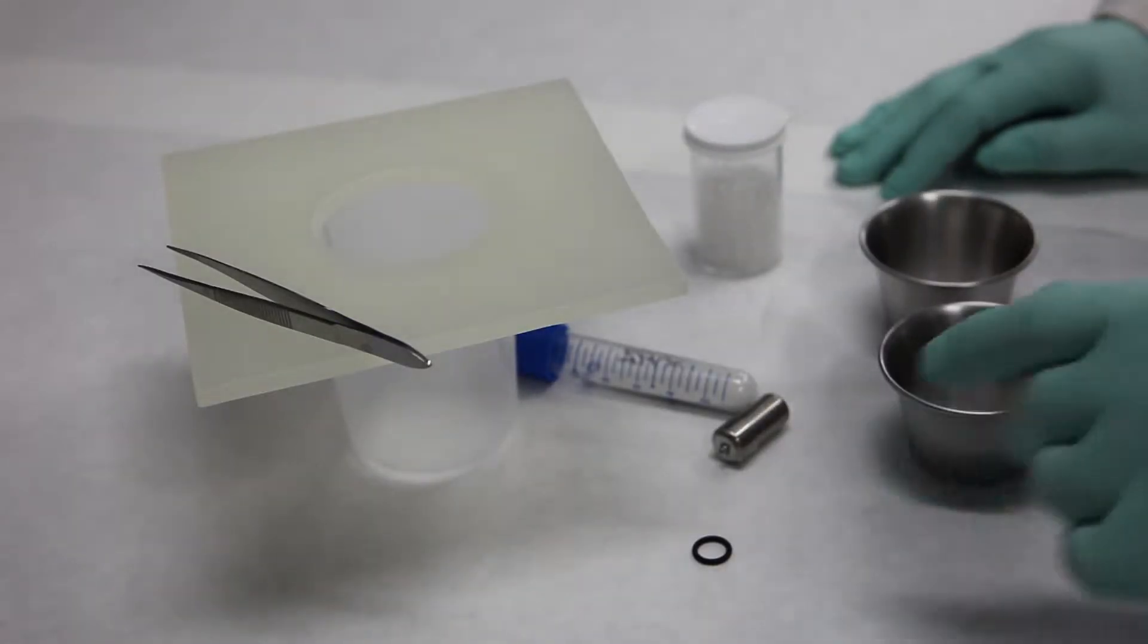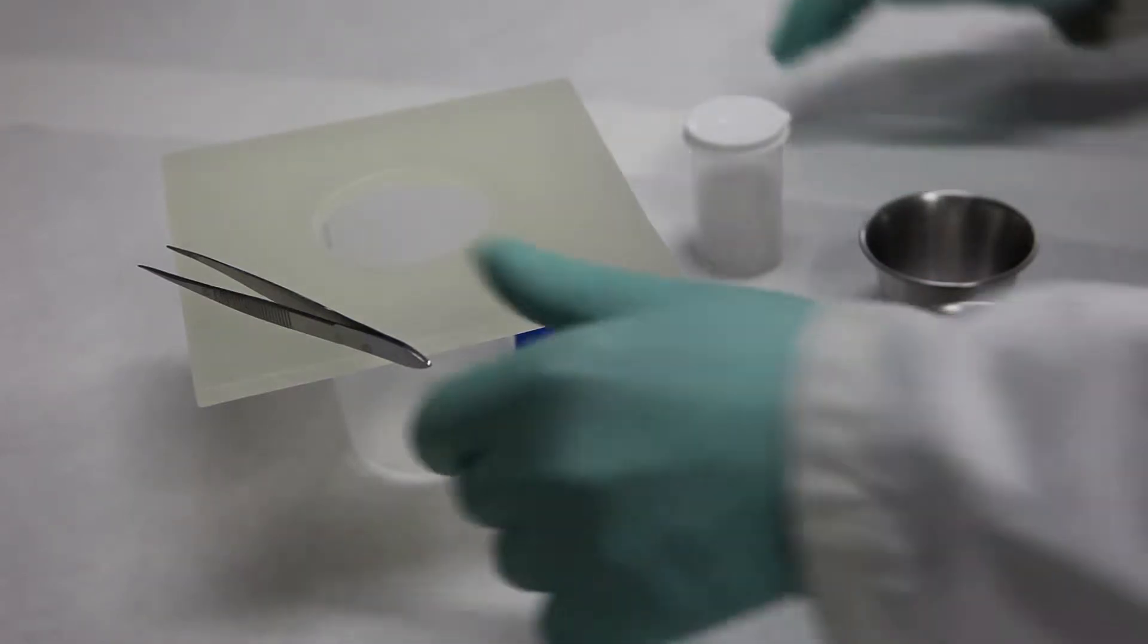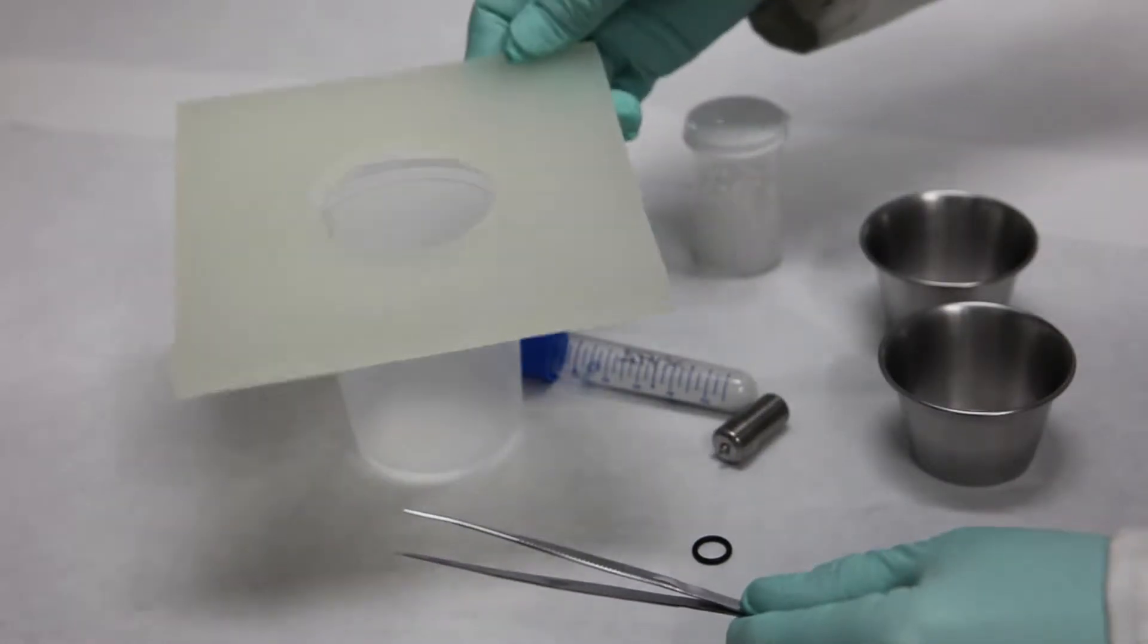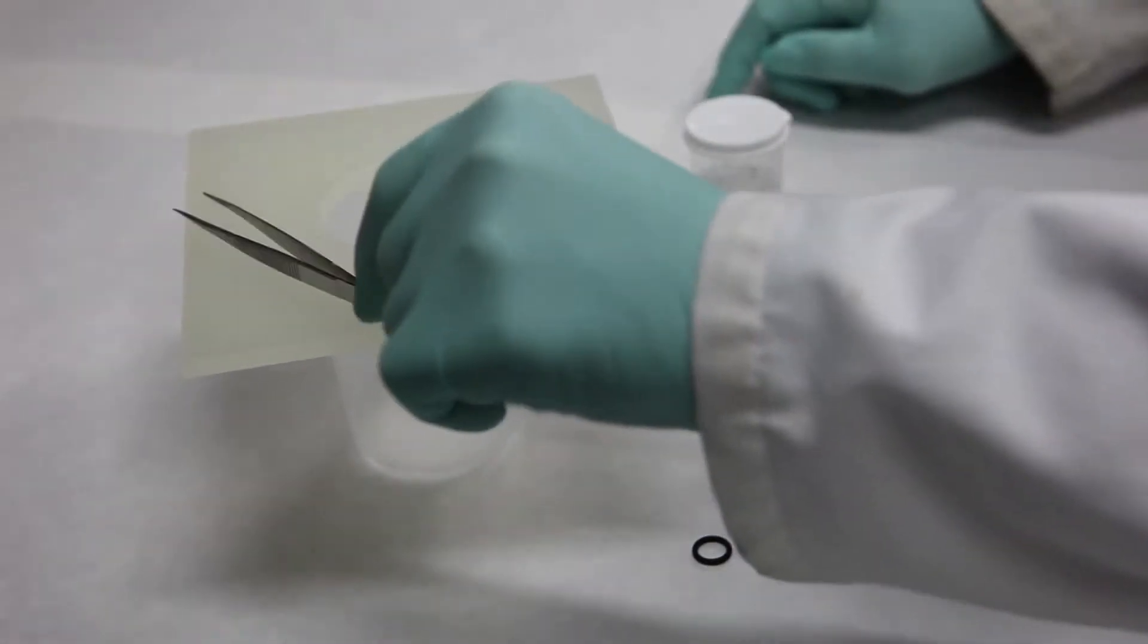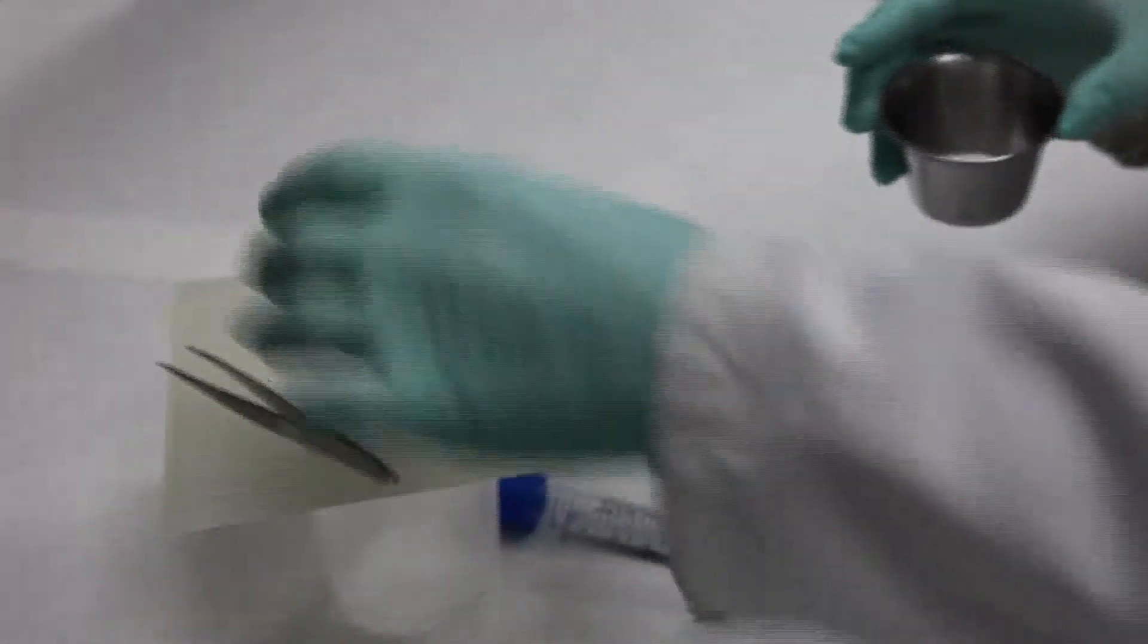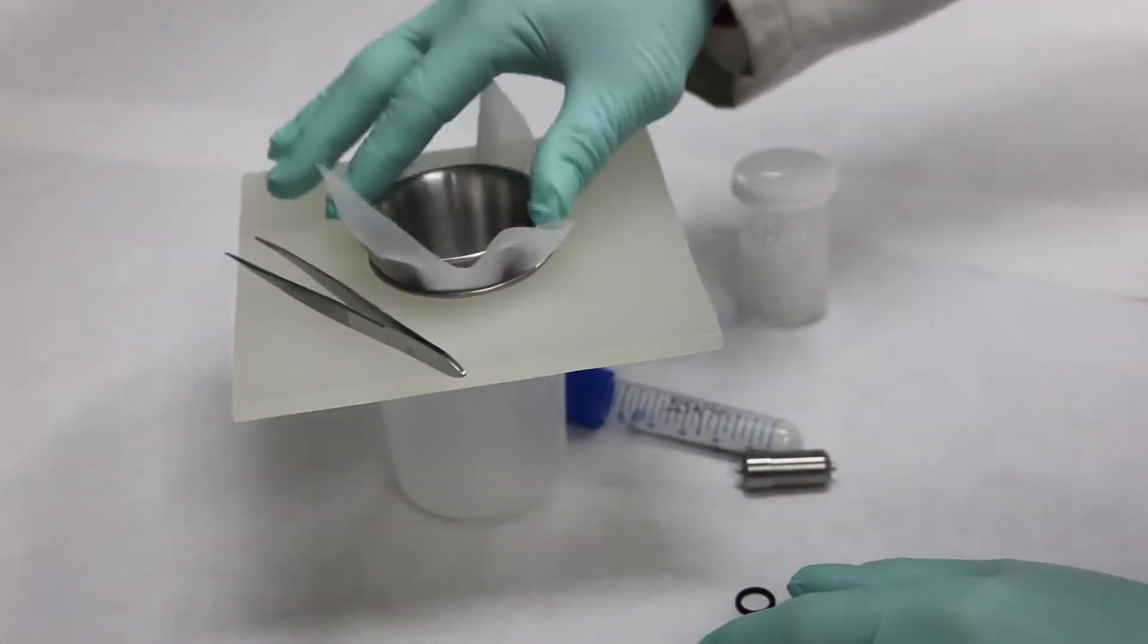These are the items that I use when I'm putting together the wiggle bug to put in the wiggle bug shaker. We need tweezers, a tricorner beaker, plexiglass with a hole cut in it, two cylinders like so, and in between the cylinders we're going to put some 20 micron opening nylon mesh.